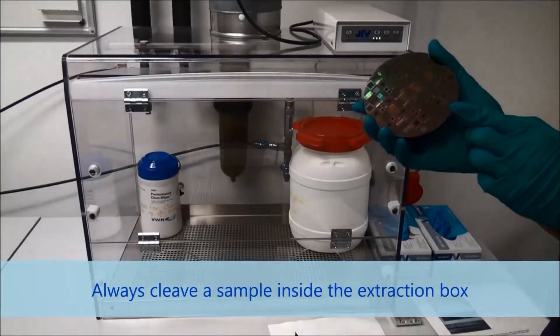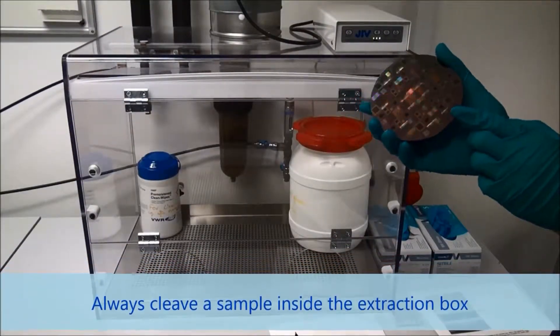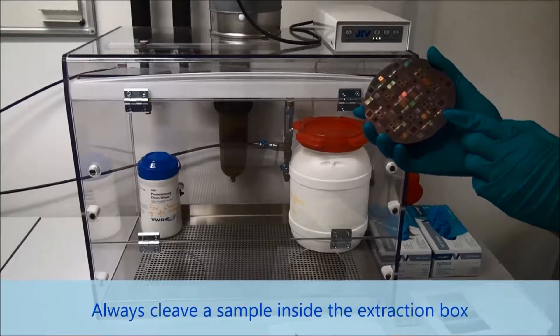Here I have a 4-inch wafer, and I want to look at a cross-section. So first, I have to cleave the wafer.